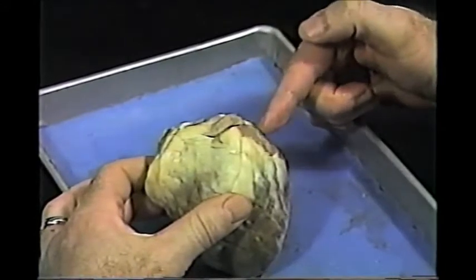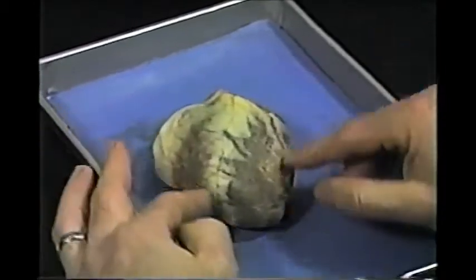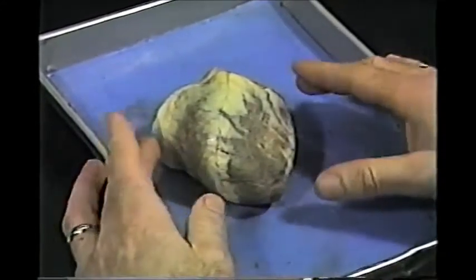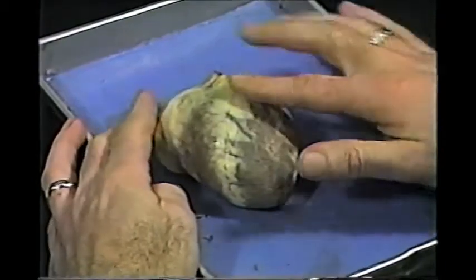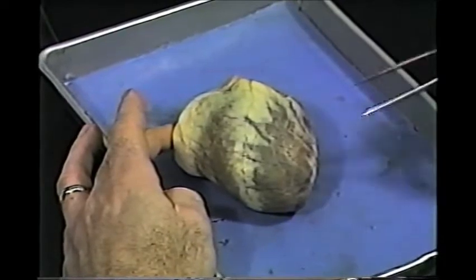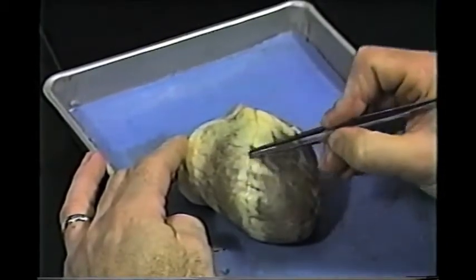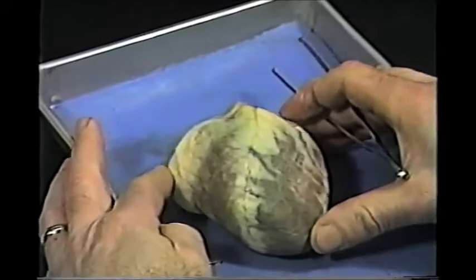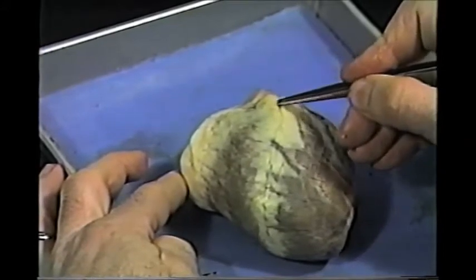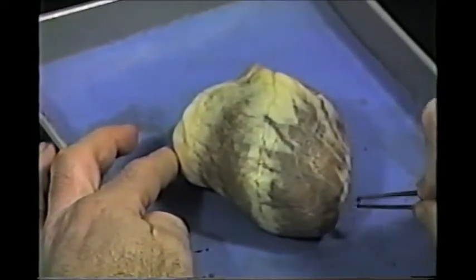The top of the heart is the widest part and, oddly enough, is called the base. It tapers down to a point which is called the apex. Now most of the heart is ventricles — all of this from here down — and the heart is divided up into two ventricles. This line that separates roughly the two ventricles: you want to position the heart so that this line crosses from your right to your left and the apex is on your right.